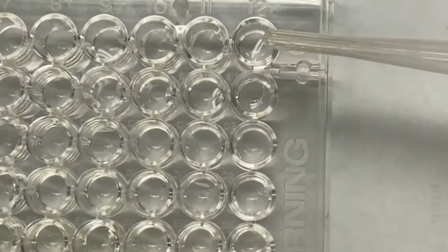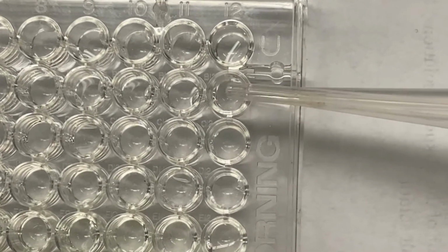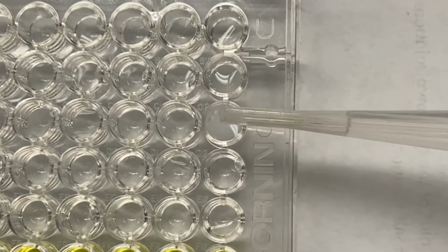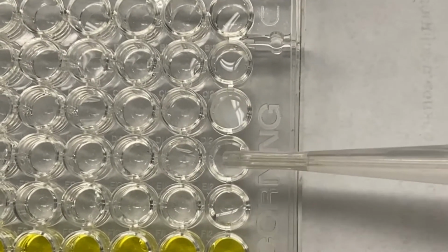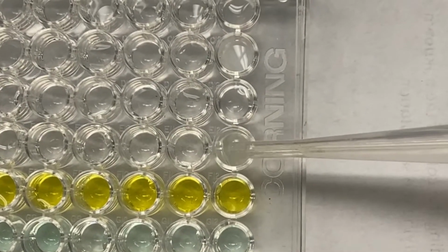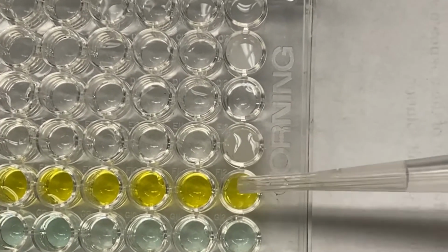So I had two drops. Okay, I can't see anything happening there. I think I'll just go down and do everything and make my observations. Oh, I see a precipitate in this. Nothing here, same, soluble. Same, soluble as well.